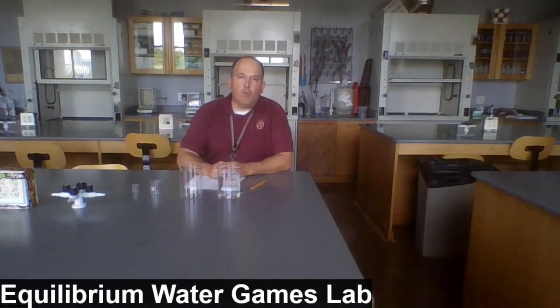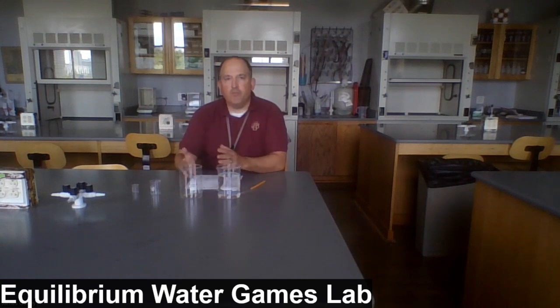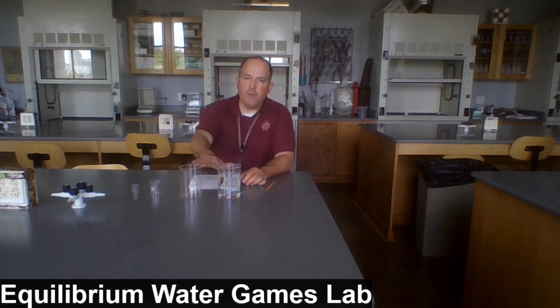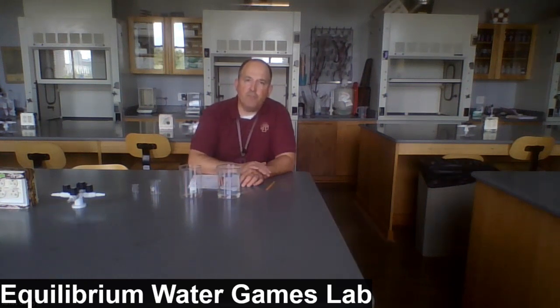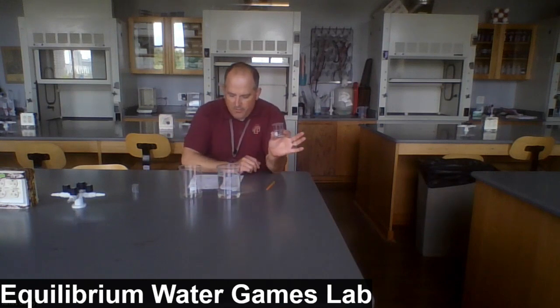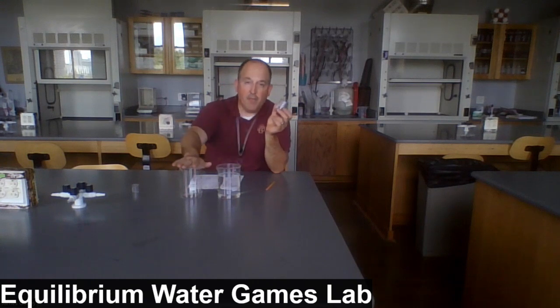This lab is called Equilibrium Water Games. And in it, we're going to serve as a short introduction to equilibrium using water transferring between two beakers as our model. We have two large beakers, 600 milliliter sizes, and one of them is filled to the 500 milliliter mark. In part one of the procedure, we're going to use the 50 milliliter beaker to transfer water from the large beaker A to beaker B.